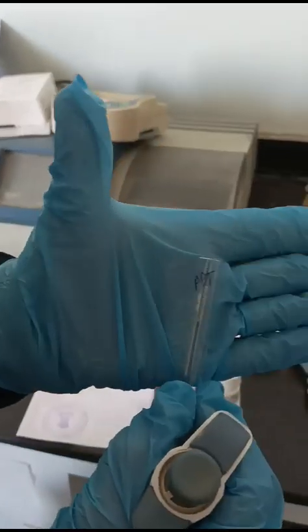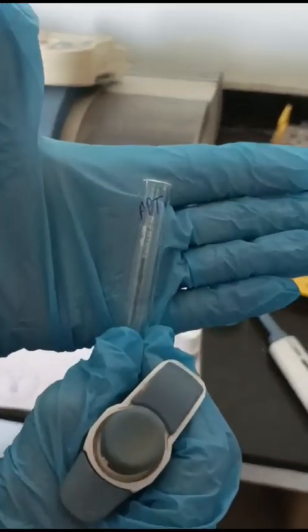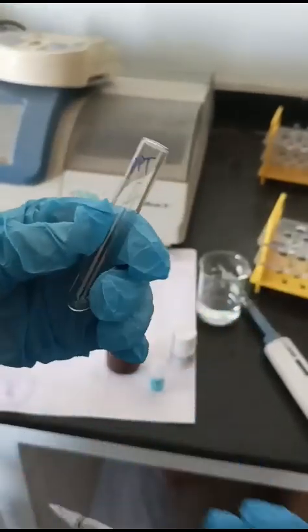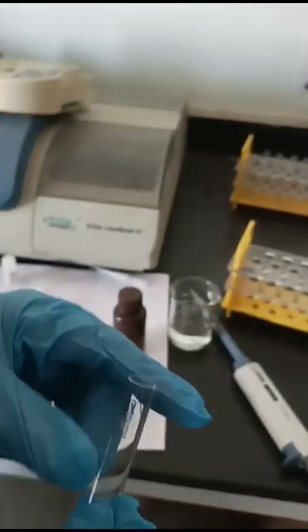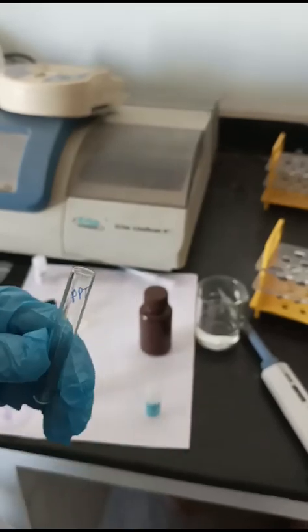The extra step is that we will be using a precipitation test tube where we will be taking a precipitating reagent and samples. The samples will be 300 microliters.